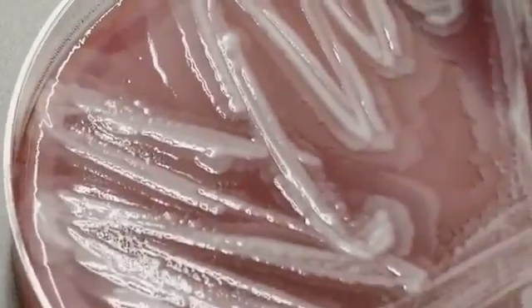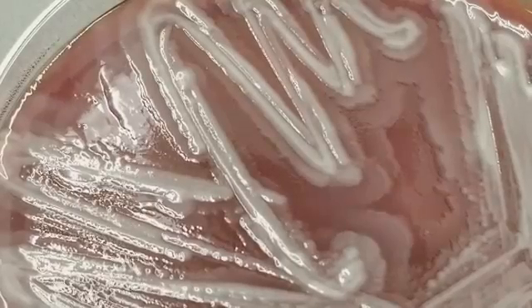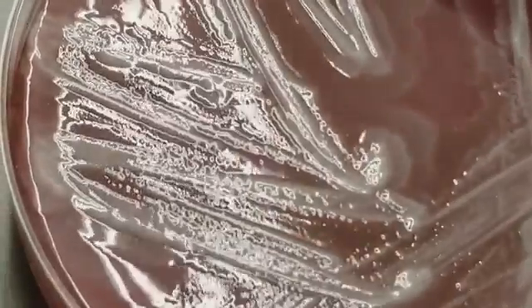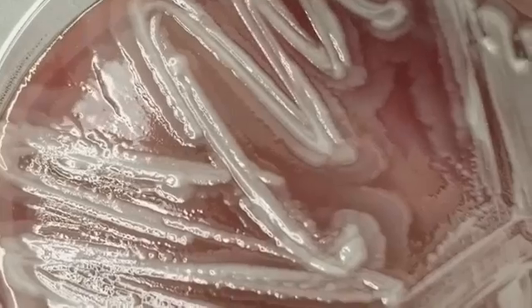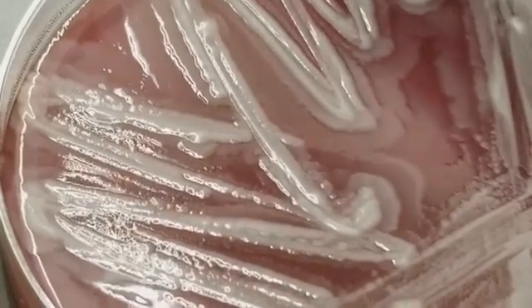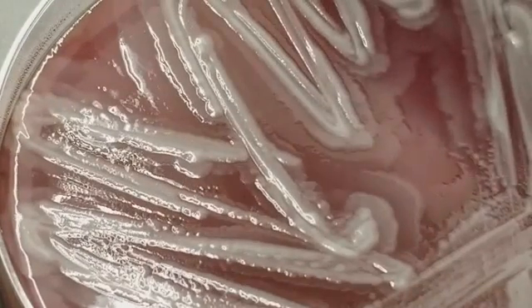All right, so this one is going to be fun. This one's from the left arm. Look at that. Isn't that gorgeous? So this, I'm assuming, was from a wound on the arm, and this, as you can tell, is a GNR in regard to that scalloping, but also there's what's called swarming, and you can see it because it's waves of growth.